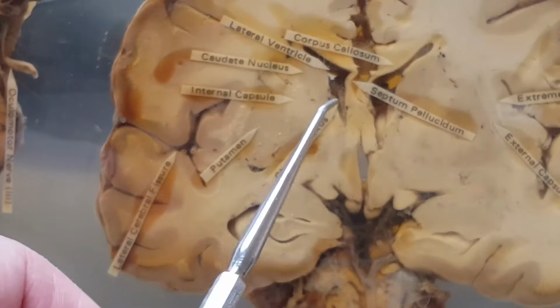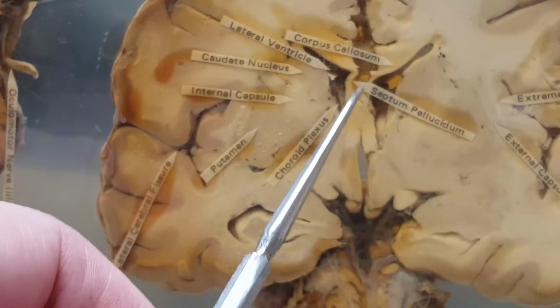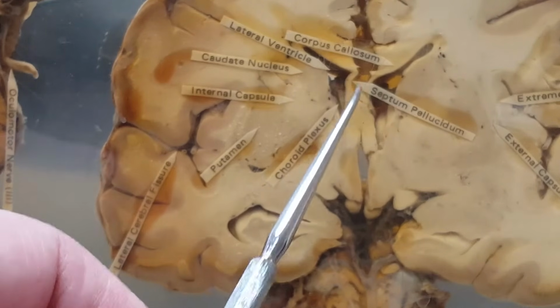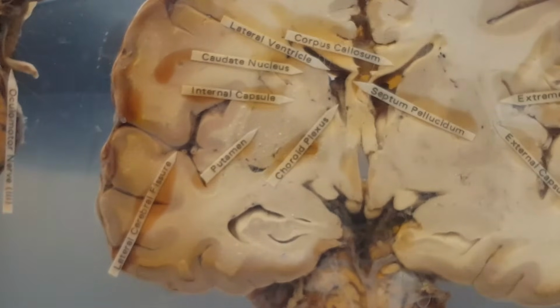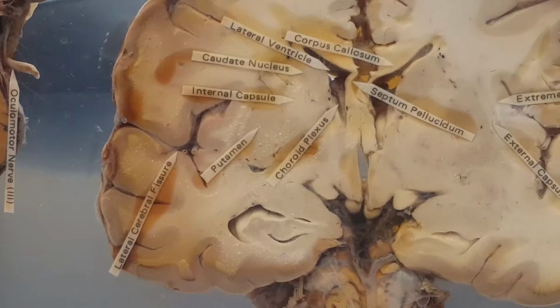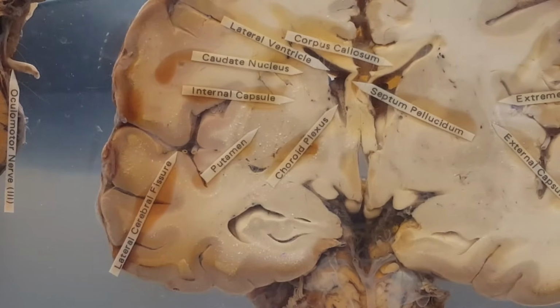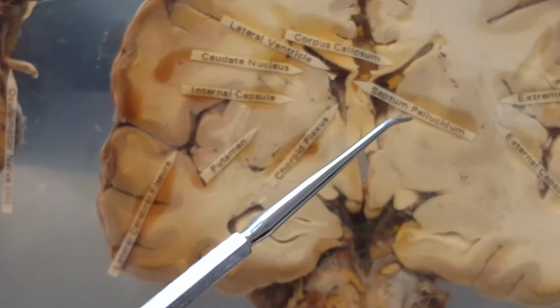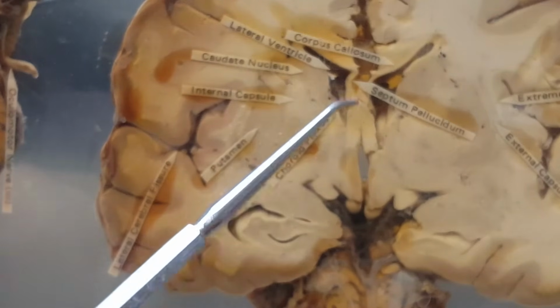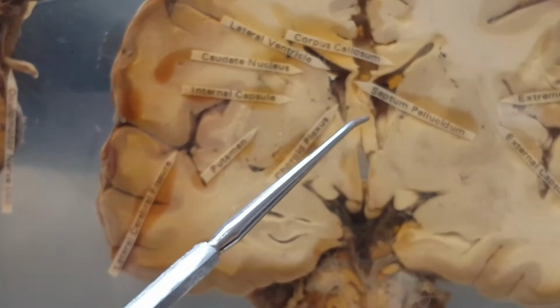So I've got two hollow spots, one here, one here. Those are the lateral ventricles with a little wall between them. That wall is called the septum pellucidum. I want you to look in your lab manual. Remember how, thank you Professor Hicks and Professor Larson, it's numbered, and the diagrams, you got to use those. It's already drawn for you. Lateral ventricle here and here, and the septum pellucidum, clear wall separating them.